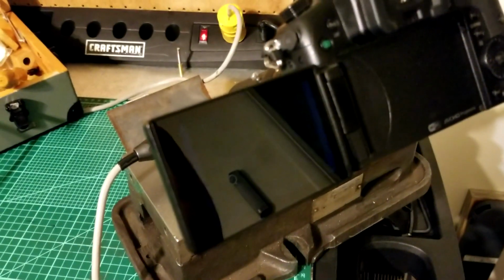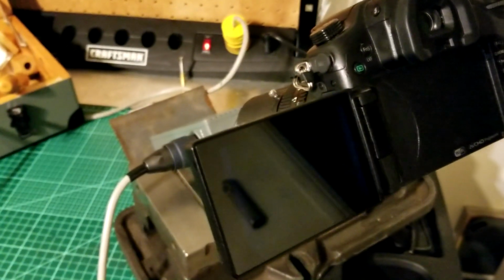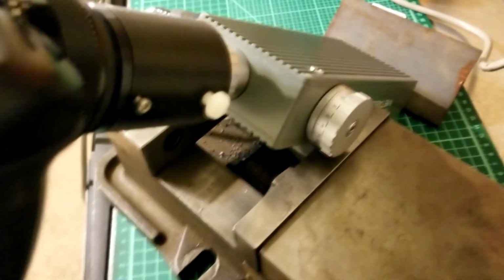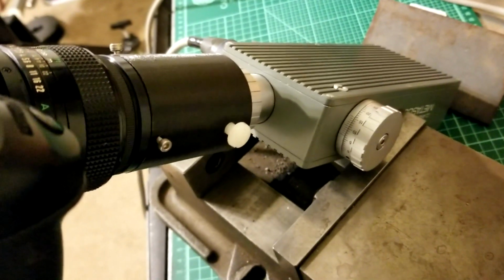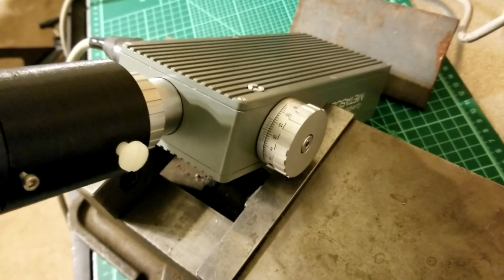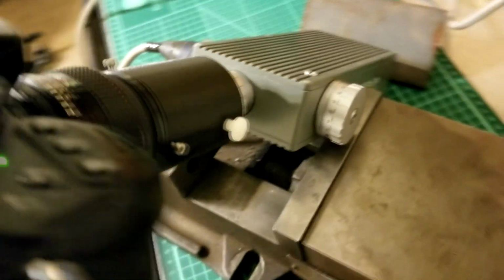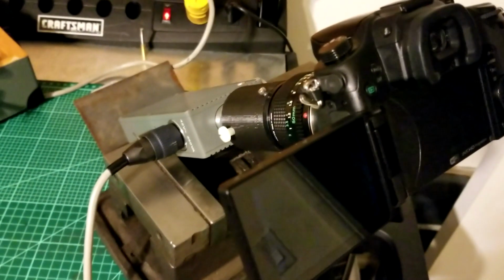So I'm at a total loss of what could be going on here, or what I might be doing wrong. I was pretty excited that the adapter even worked. And I proved that something does come on the screen when I had the flashlight shining in the prism. So I'm pretty much at a loss. If you have any ideas, I'd sure like to hear what they are.